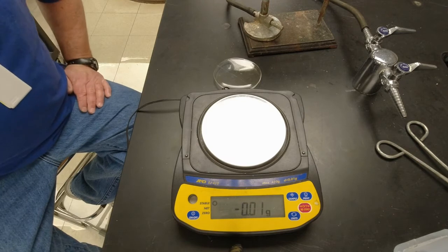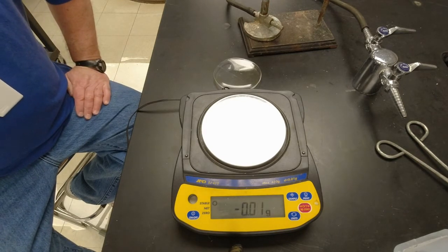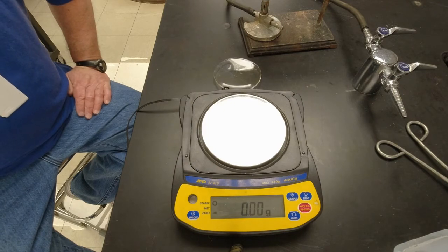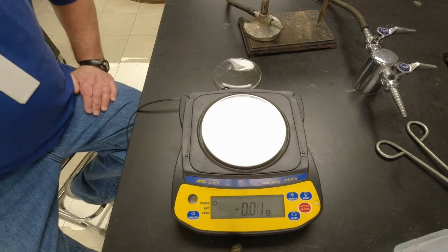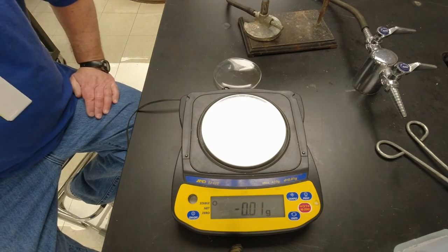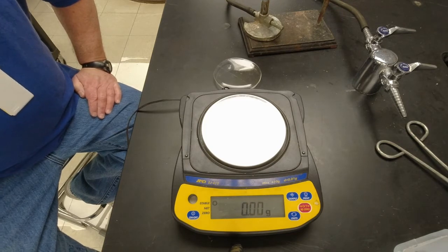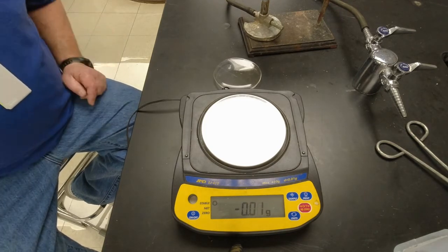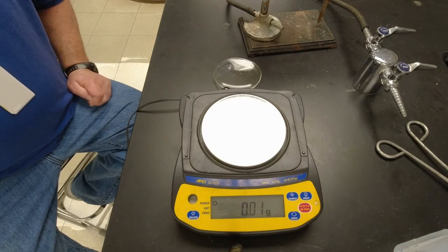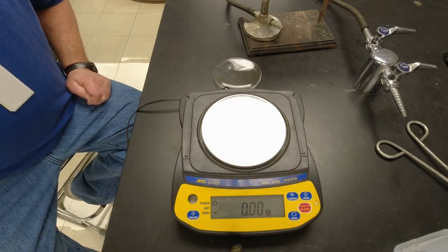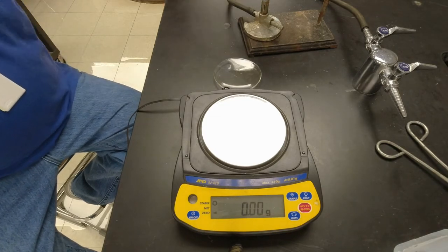So what we're going to do is we're going to add hydrochloric acid to sodium bicarbonate, NaHCO3, and it becomes carbon dioxide. That's what makes the bubbles. You're going to get water, H2O, and you're going to get sodium chloride left over. And so basically after we're done adding the acid and the bubbles come off, what's left over is salt water. And then we're going to evaporate the water off and what should be left is salt if we do it carefully enough. This is kind of tricky to get it just right.